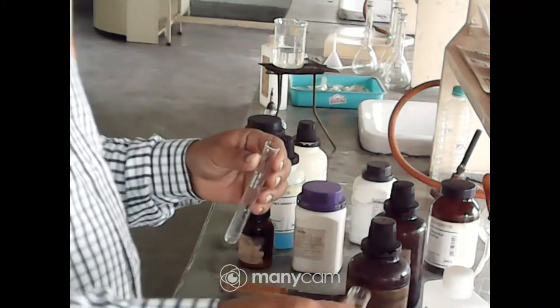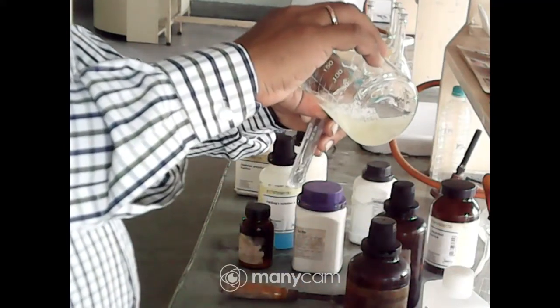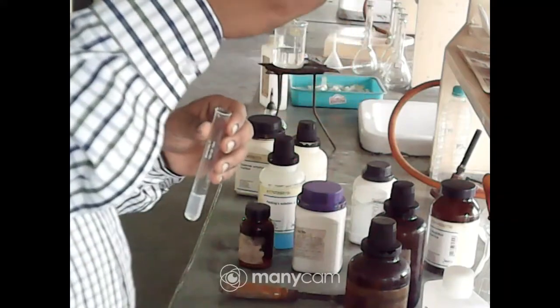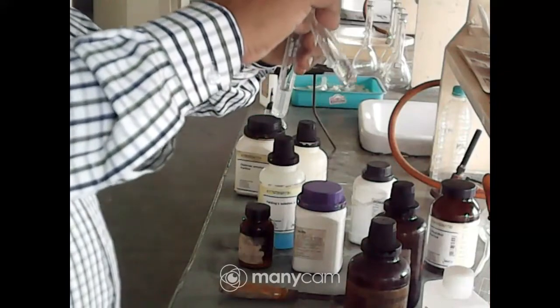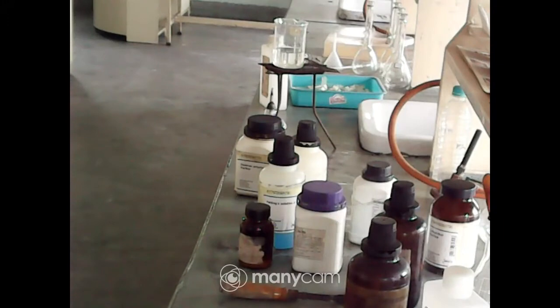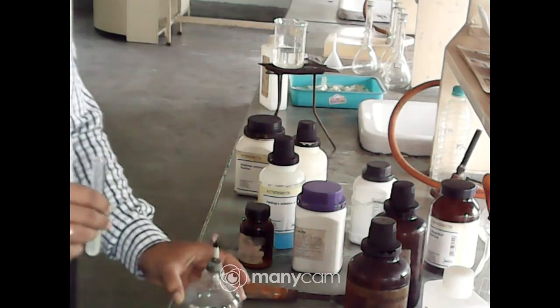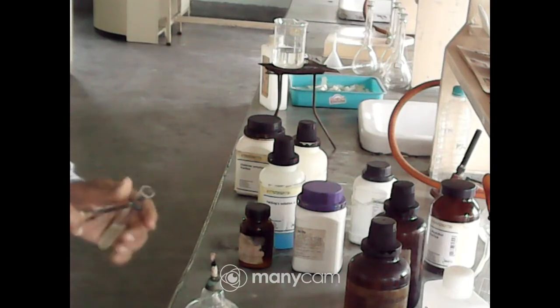Take the sample solution. Add this ninhydrin reagent. After that, heat it. When you heat it, just use the holder.